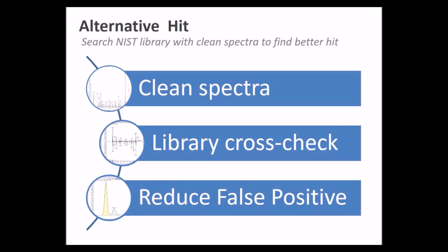The purpose of the alternative hit is to take that clean spectra that we talked about and go to a library like NIST and cross-check that library to find out whether there actually is a better spectral match than the target that we've assigned it to. And the idea here is that we want to reduce false positives.